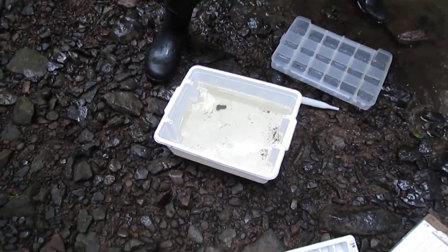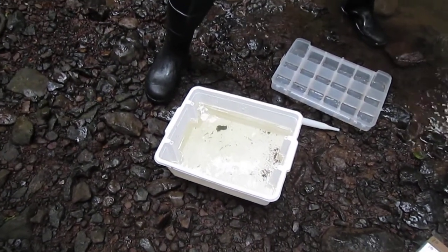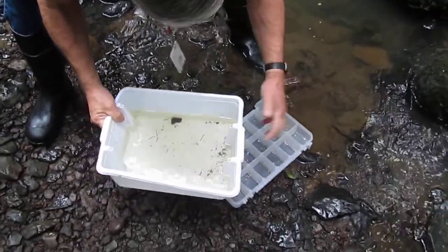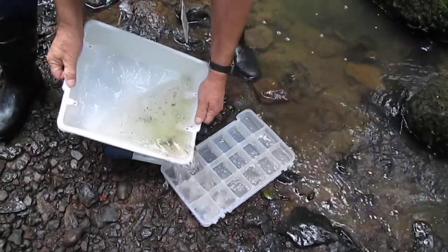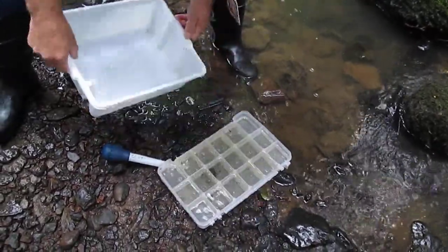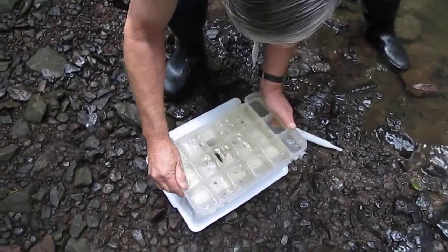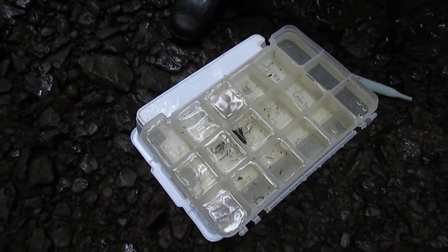Once you have collected three D-Nets of macroinvertebrates, the next step is to take all the contents of the white tub. Swirl it to make sure all those contents get into the subsampling tray and evenly distribute that water throughout. Because of time constraints, the best way to count the number of bugs is to take a random sample of the 18 different slots that are in that subsample tray.